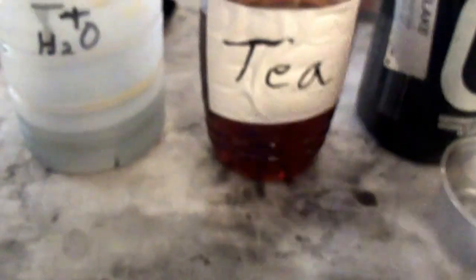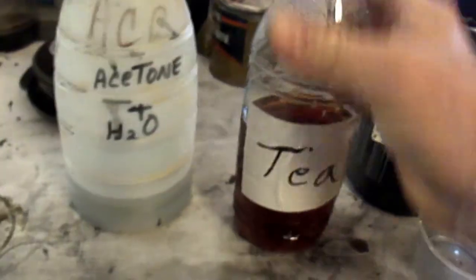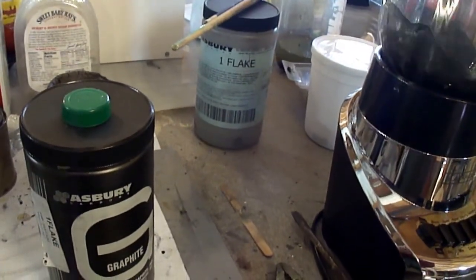That's what it looks like. Put it down into my blender. Then we'll take just regular tea that you would drink, like for breakfast. And that keeps it in suspension.